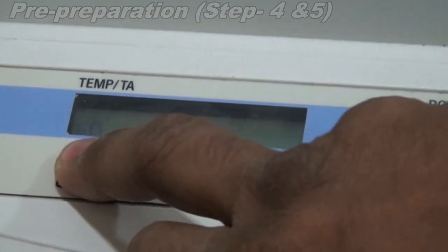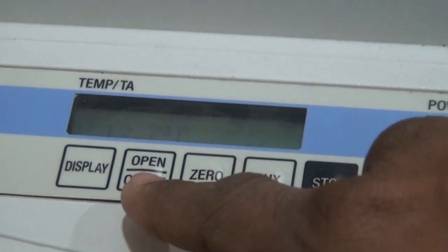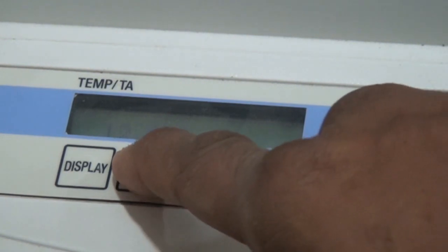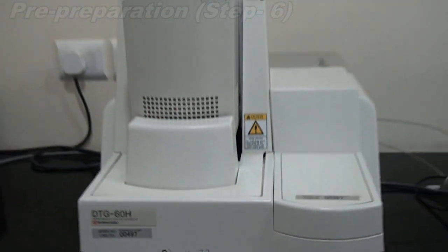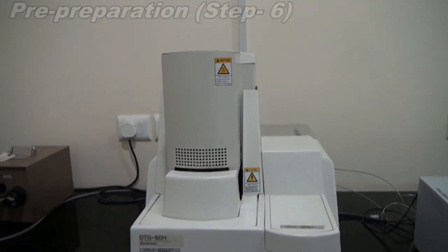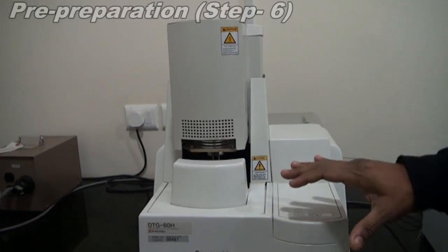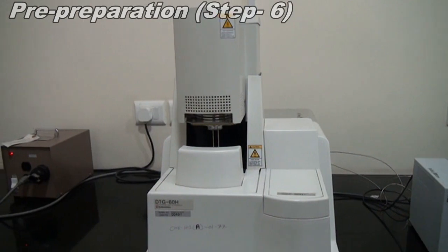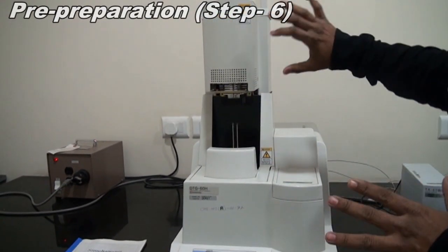Okay, so everything is done. Then you need to press the open and close button, and the furnace will open. As soon as you click the open and close button, the furnace will lift up and be raised completely. Here you will see the two pans.